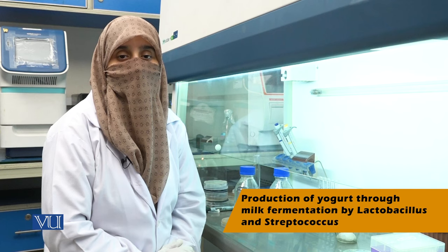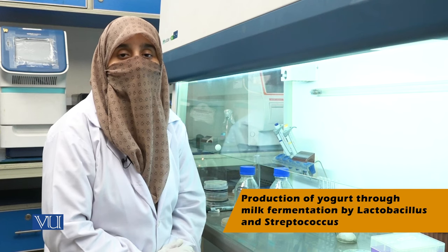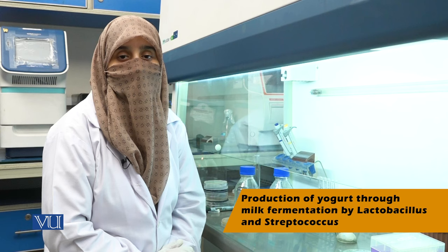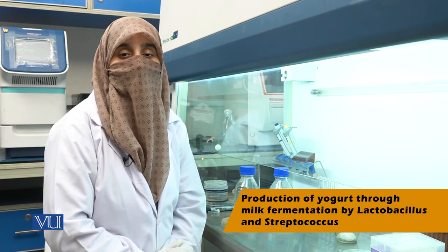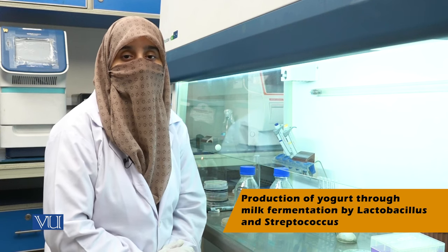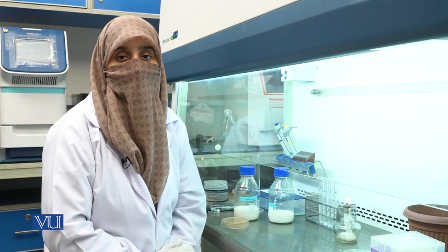Lactobacillus are commonly used in food industries, and these bacteria have the ability to ferment lactose into lactic acid, which is the basic product after inoculation into the milk.